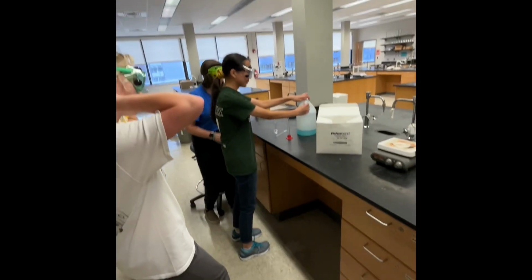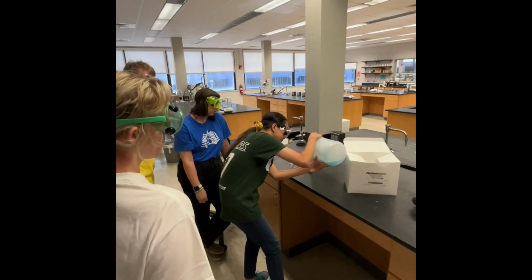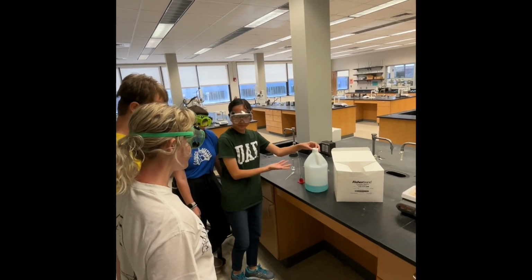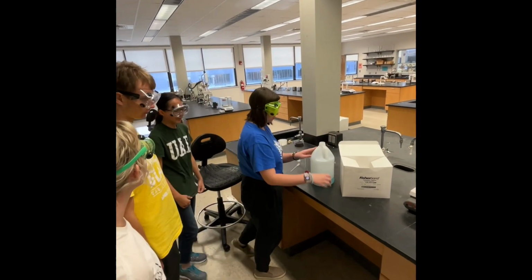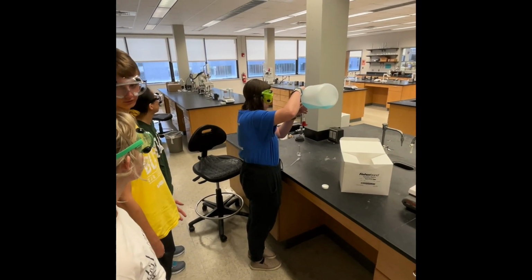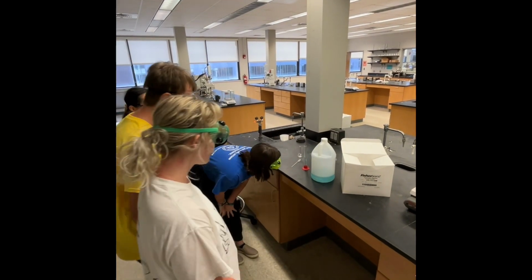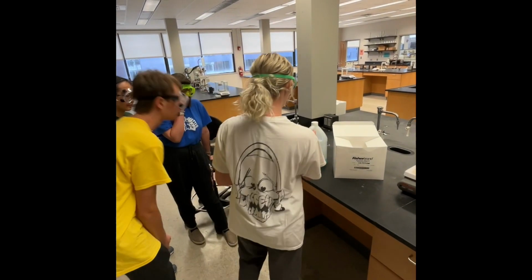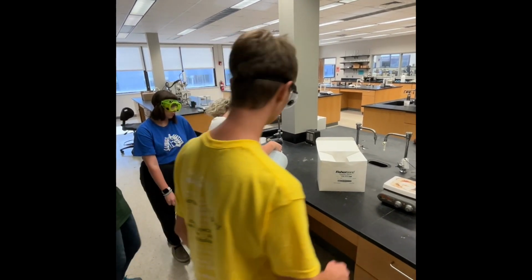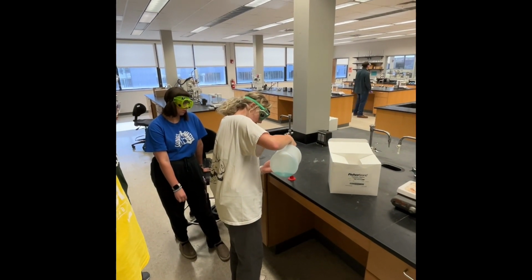First, our lab members washed our hands, and then we proceeded with pouring about 25 milliliters of our stock solution into a graduated cylinder. Now I want to take the time from this extra footage to talk about the prep that we did before starting the experiment. We had to decide what volumes of each concentration we wanted to make. These should be reasonable based on the amount of stock solution we were starting with, which was 25 milliliters, so we may want to go down to 20 milliliters, then 15, etc. We'll show what we actually did later on in this video.